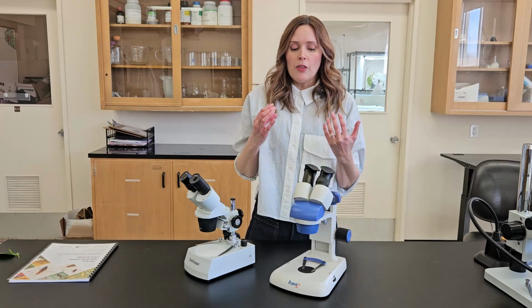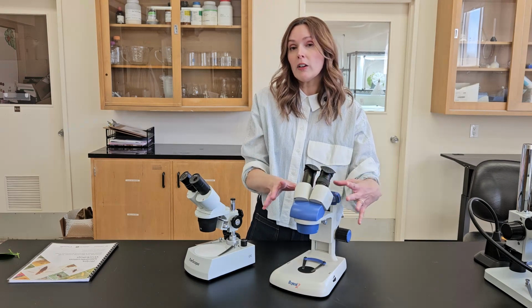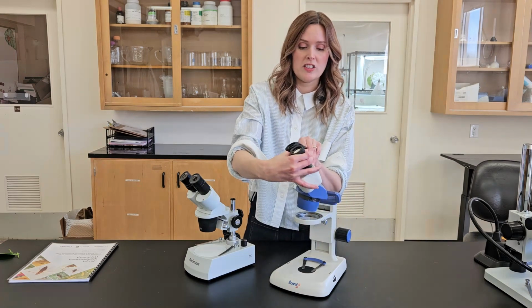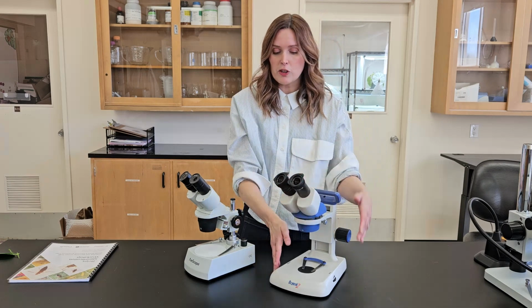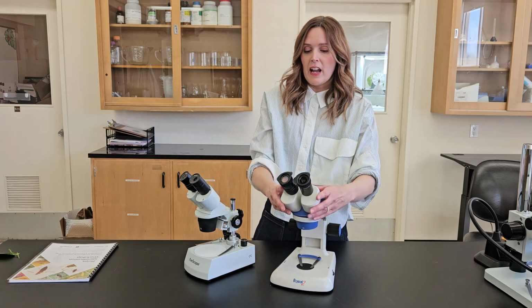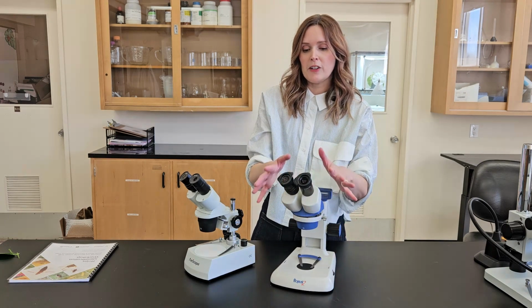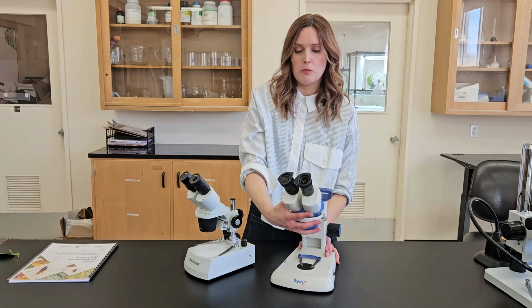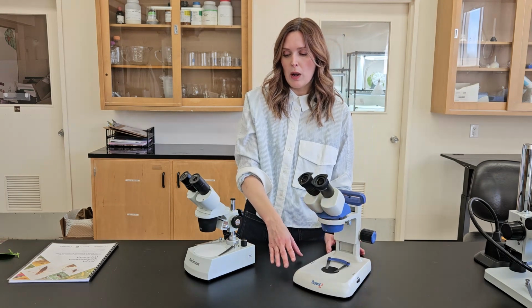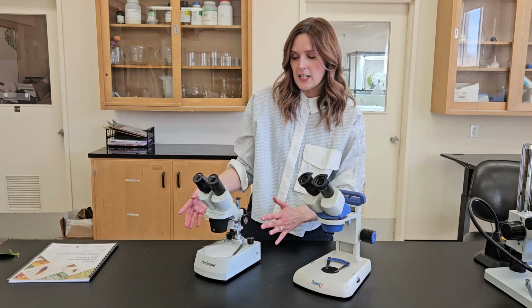So there are some microscopes that come in that orientation, but there are lots of microscopes where you can change the orientation. This one is, again, one of our cheaper microscopes, the Boreal, and it's around the $200–300 range again. And the benefit of this one is you can move it around to be facing the stage how I prefer. And this one, same thing, it faces the stage.